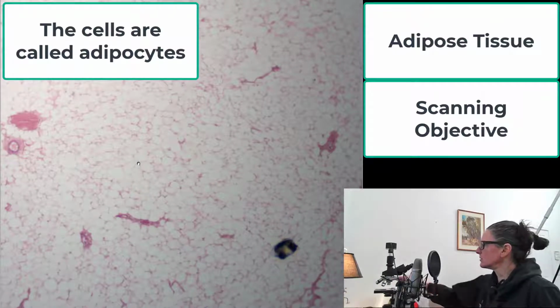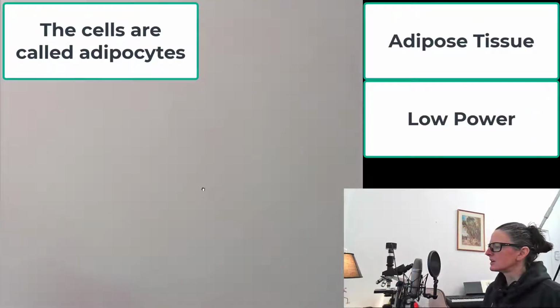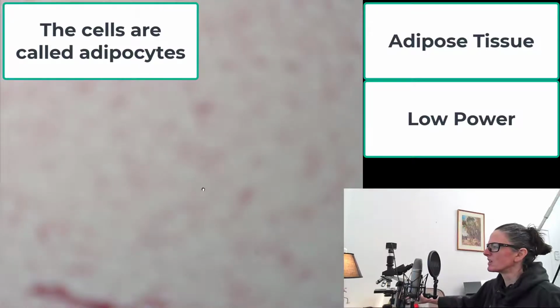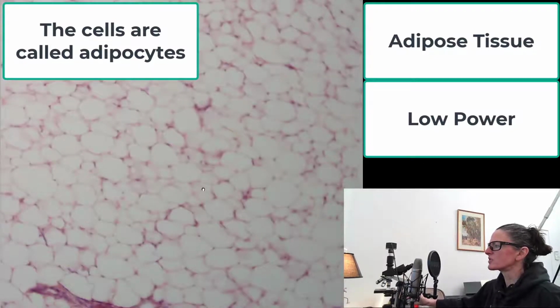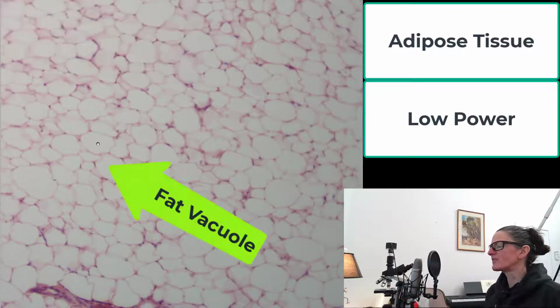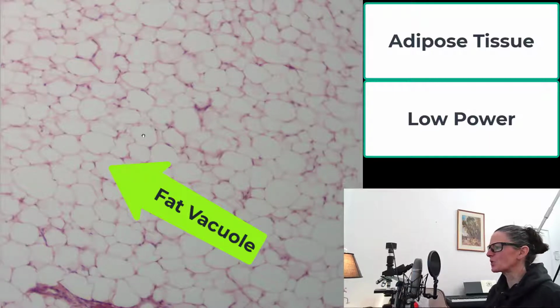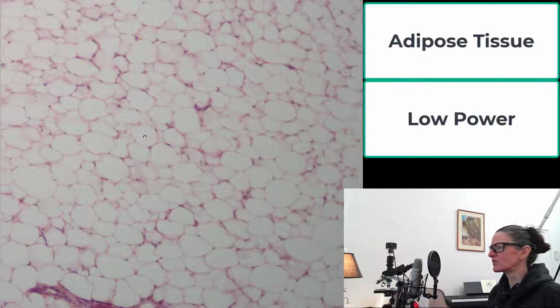So I'm going to go ahead and move it up to the low power objective now, and we'll refocus it so that we can sort of see a little bit more about the structure of these cells. Now, these big open spaces in the center are what we call the fat vacuole. This is a specialized part of the cell that is going to be what stores fat. So it stores fat in the form of a triglyceride. So this thing is just full of triglycerides.